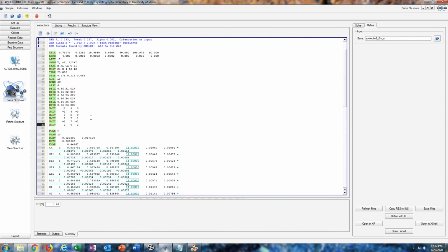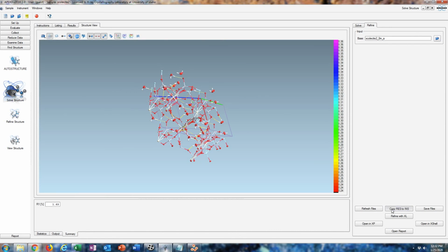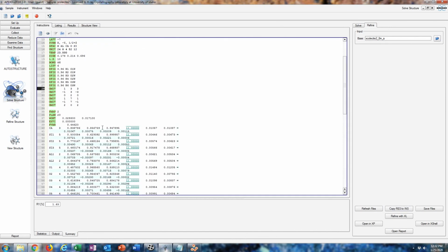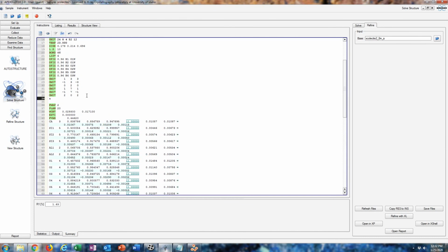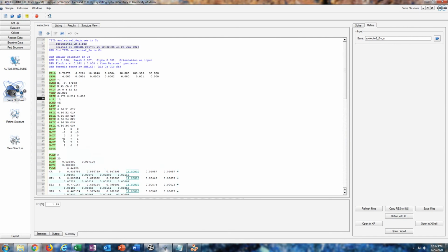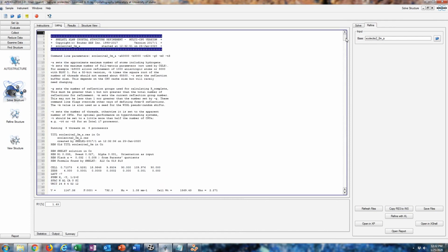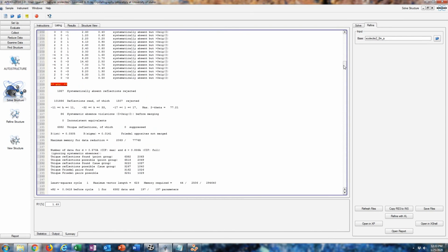And this will lower our R value just a little bit, but it doesn't matter too much. It's just something you can do to finalize the structure. Then enter in your ACTA command. But if you omit a bunch of reflections, it really doesn't do anything, so there's not a whole lot of point in it. So I would just omit the top few that might be screwing with the model. But yeah, that's basically it.